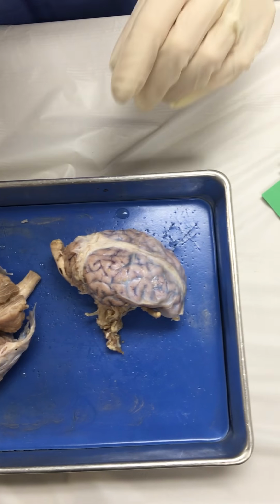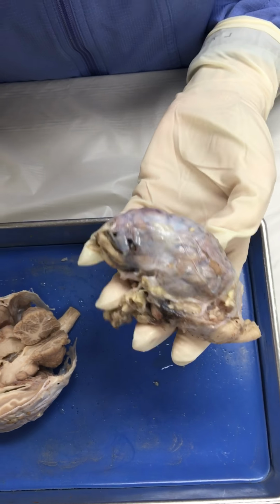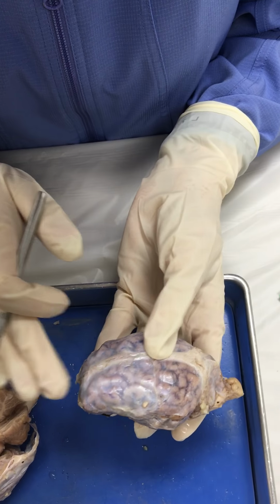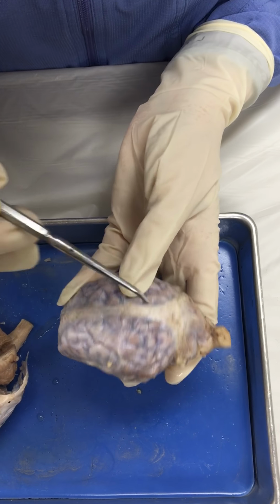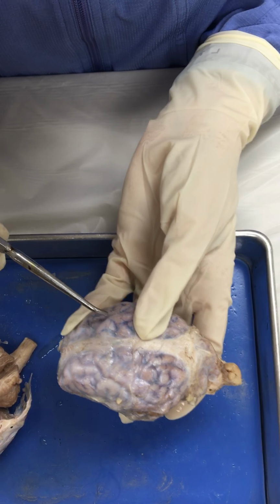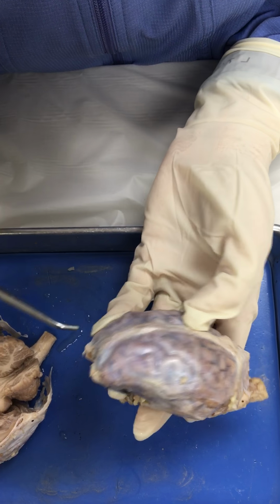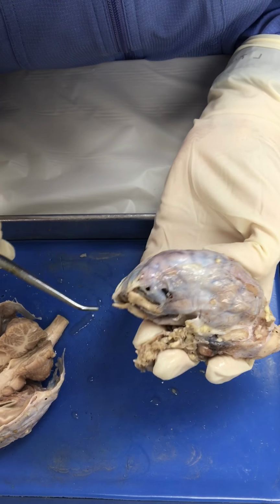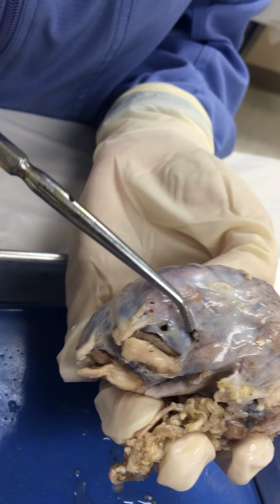Okay, so to look at just the outside of the brain, again, we'll orient. This would be the sheep's nose up at this end. This is going back towards the tail. So we have our lateral fissure down here. We have two different hemispheres of the cerebrum here. Just to look at the general areas, we have olfactory bulb around this area here.